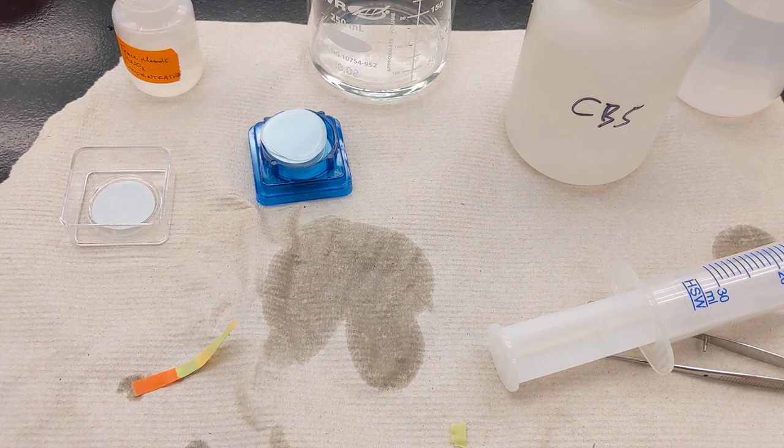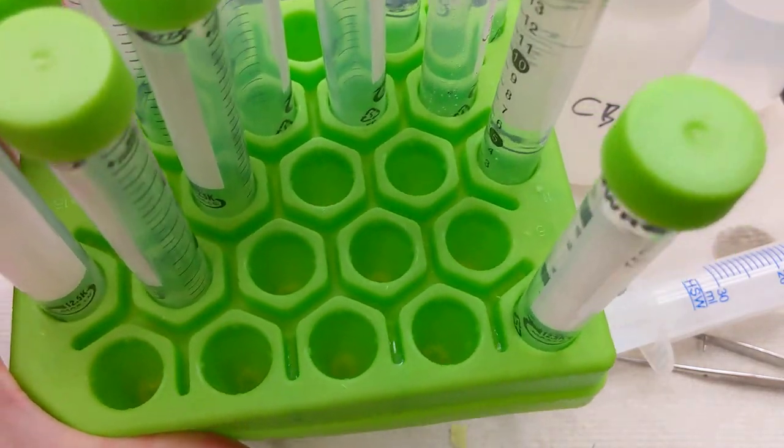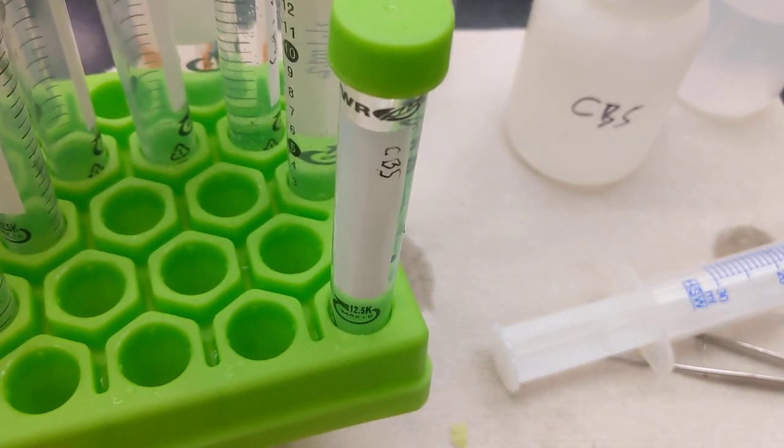And lastly, just remember to take all of your samples after you've filtered them and they're well labeled. Make sure the caps are tight, and then store this at less than 4 degrees C.